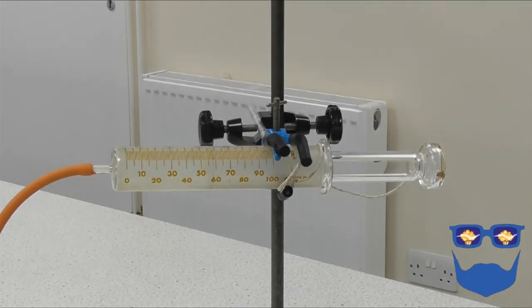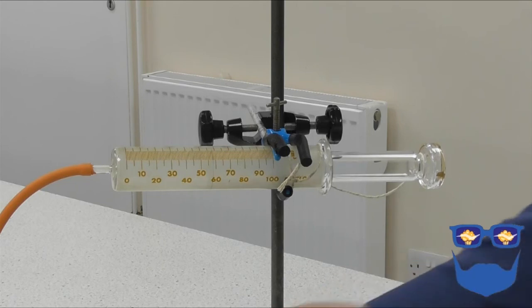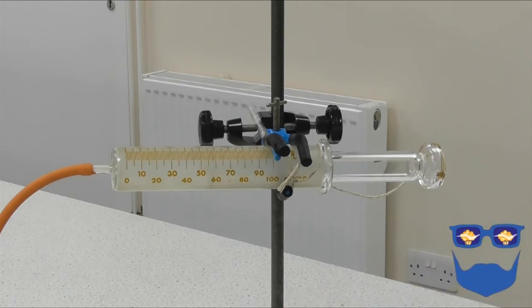So my chemical reaction has stopped. No more bubbling going on. No more gas being produced. My reaction has completed.